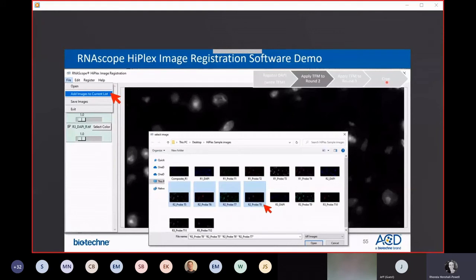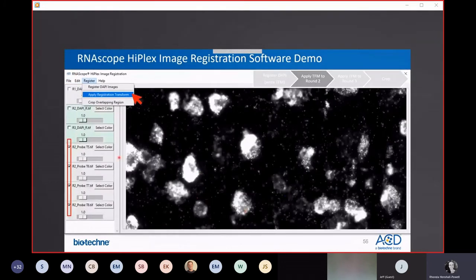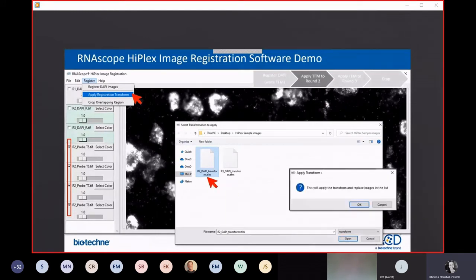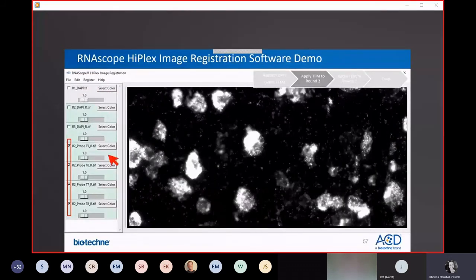And you'll find and select just the probe channels from round 2. At this point, you can surely appreciate why it's really helpful to name your files such that you know from which round of staining each image came from. Once the round 2 probe channels are added to the dashboard, go up to the Register menu, and at this point, you're choosing Apply Registration Transform. You'll select the .tfm, the transformation matrix file that was written, to overlay the images from round 2 onto round 1. Hit OK. And voila, the R2 channels have now turned green and been replaced with _R for registered.